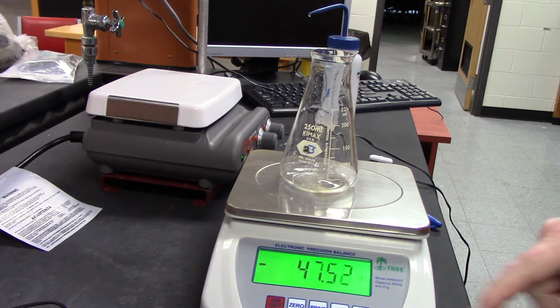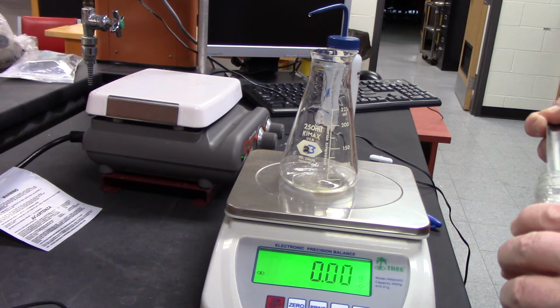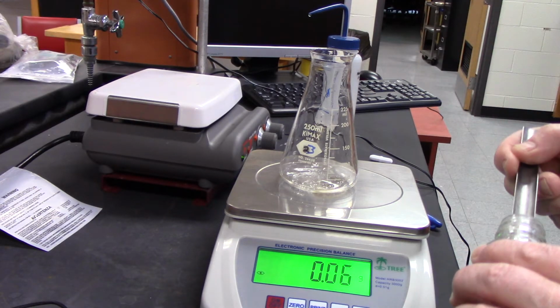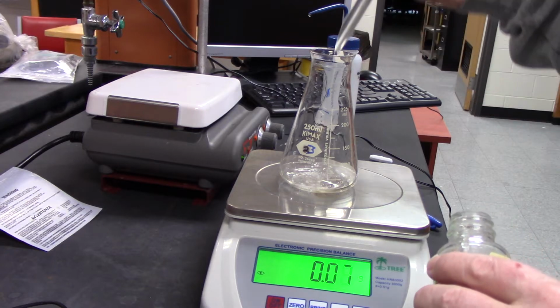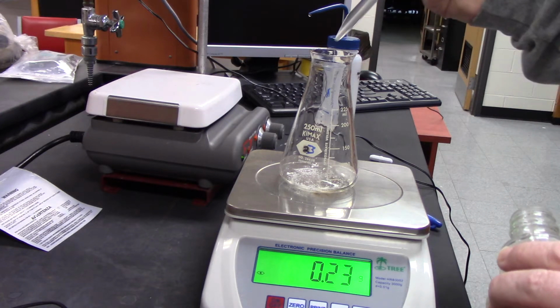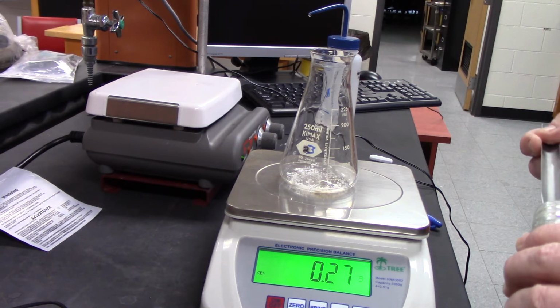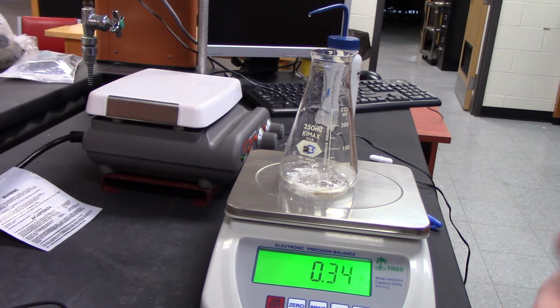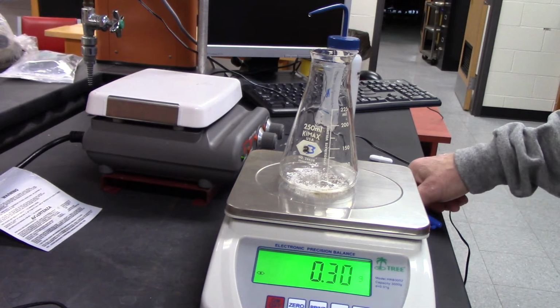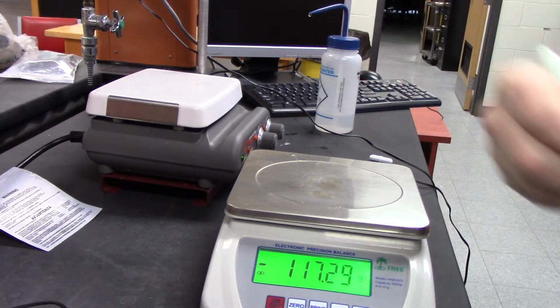Okay, third one. Number 3 is 0.30. All right, so make sure you have those written down, and we'll go on with the experiment.